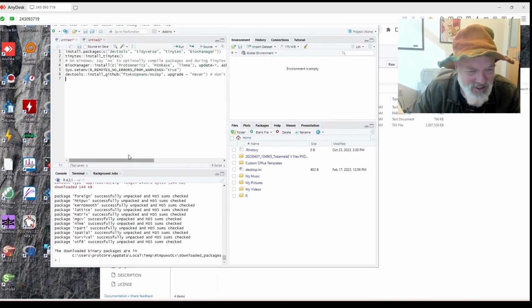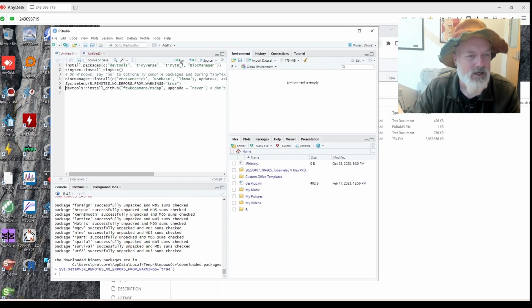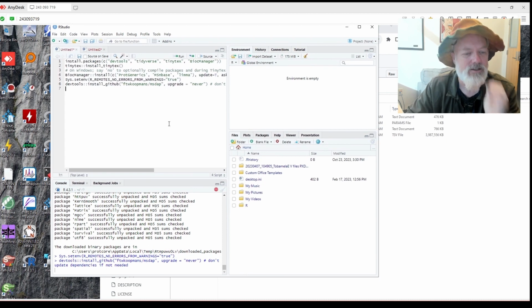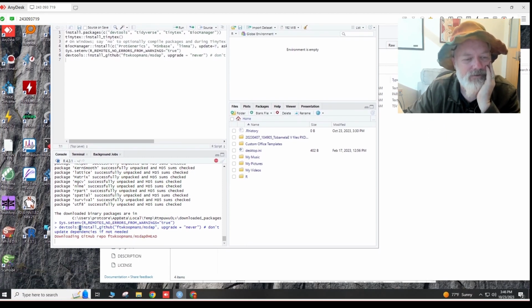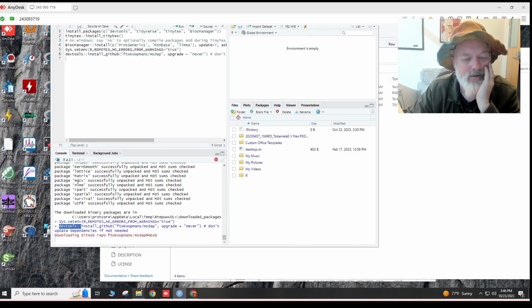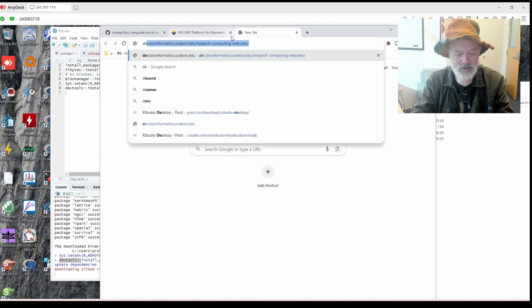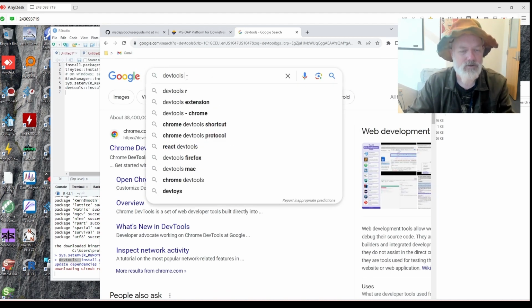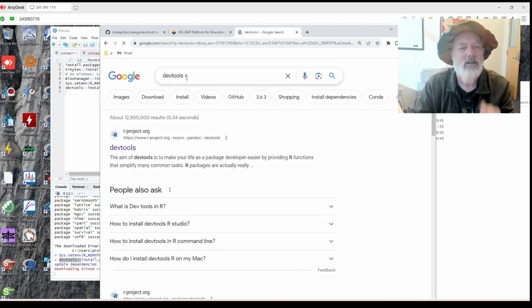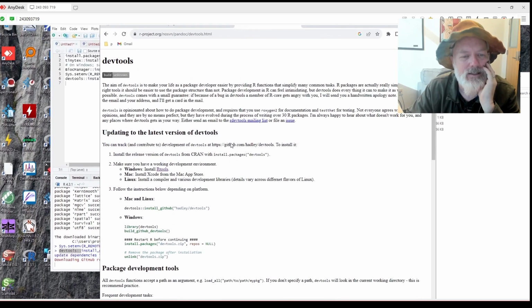All right, so it looks like that's all done. So let's try this line and see if that works. All right, that goes good. We're going to install MSDAP. You have to have DevTools installed. That could be a pain in the butt with R and DevTools. DevTools R. And I think you have to install this separately.